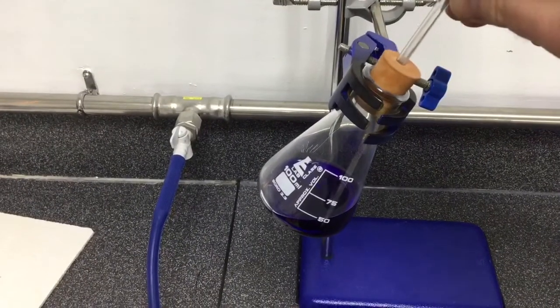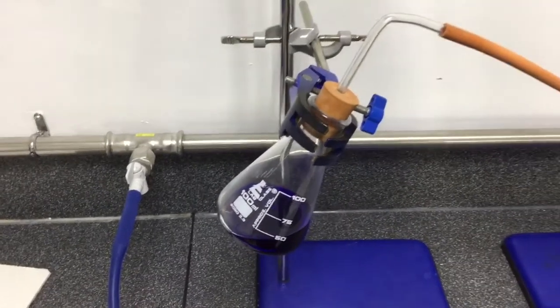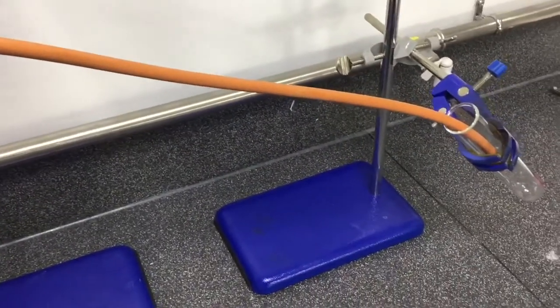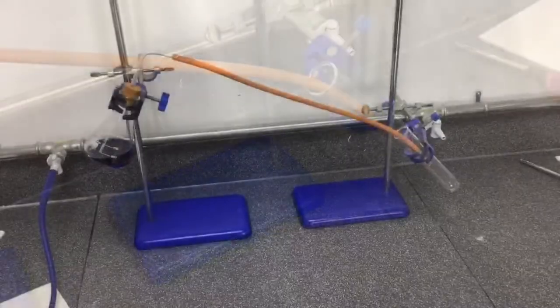Firstly, we place our inky water mixture into a small conical flask. To this we attach a bung with a delivery tube which leads to a small test tube where we can collect the water mixture.